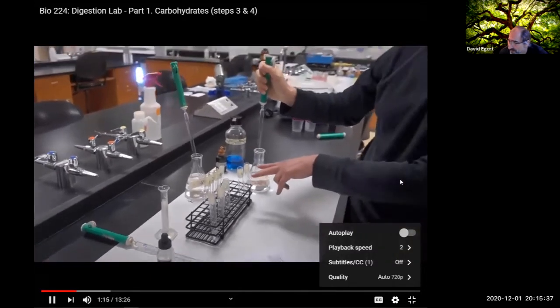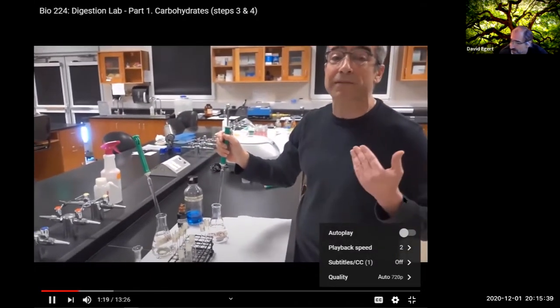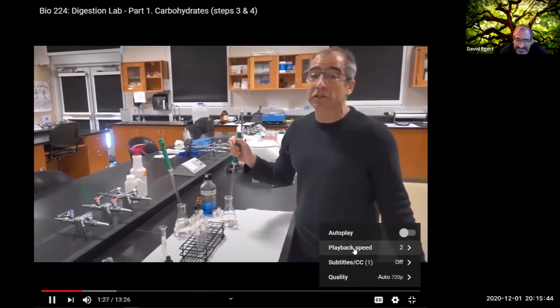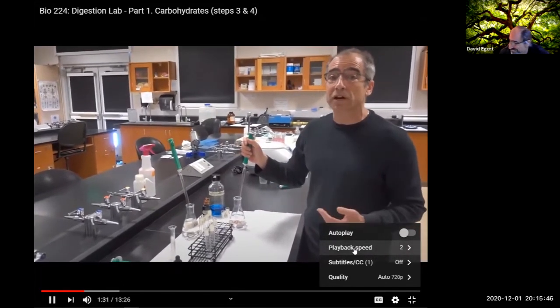And then also 4 and 5 are going to be controls. Part of an experiment, whenever you're using some kind of an assay, you want to validate your assay. Make sure you give your assay something where you know what the answer is supposed to be, and make sure you get the answer that you're expecting. So then you trust what the answers are when you're looking at your unknowns.